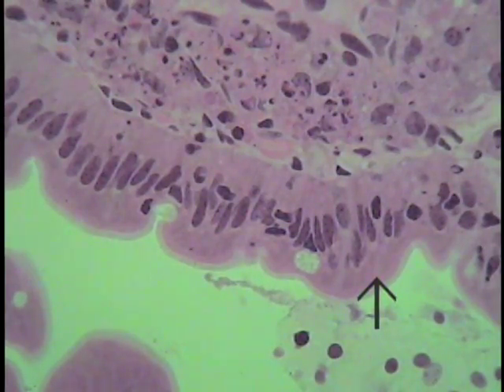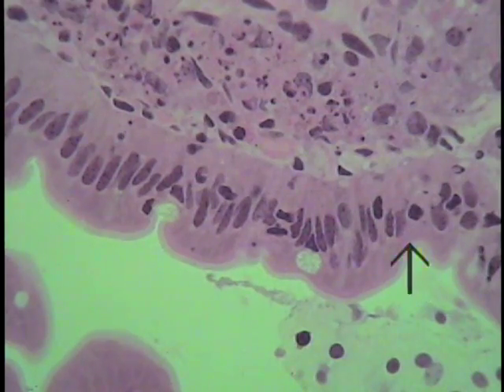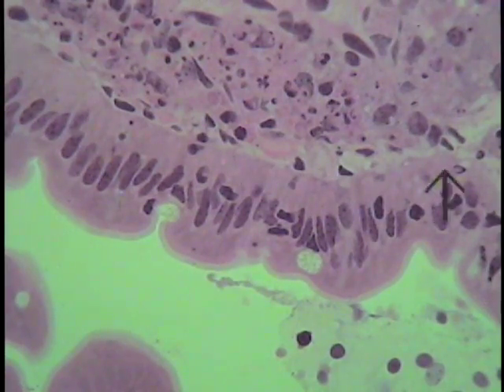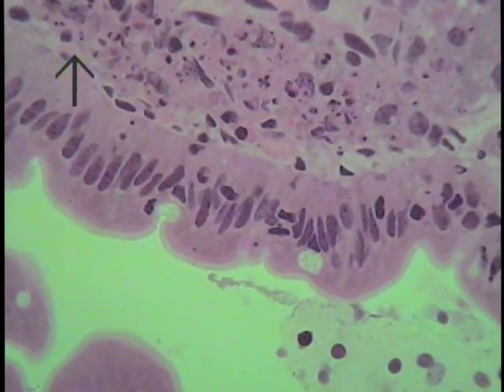This is a region of the luminal surface of the small intestine showing a simple columnar lining epithelium or an intestinal epithelium. The epithelial layer extends from here to here. Though a basement membrane isn't visible on this particular section, it should be residing right about this location.